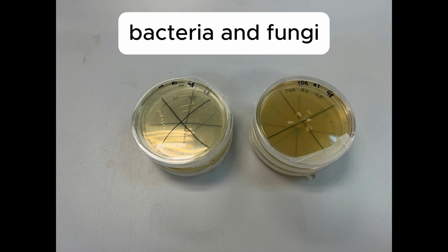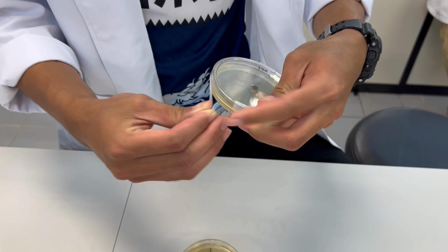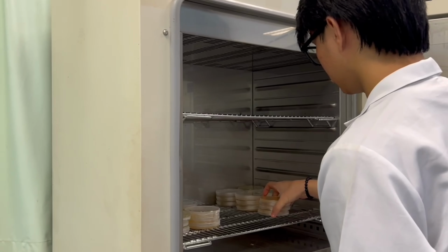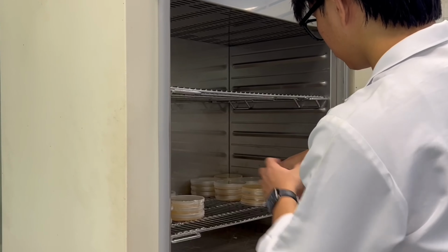The inoculated PDA and NA plates were sealed using parafilm and incubated at 25 Celsius for 24 to 72 hours.